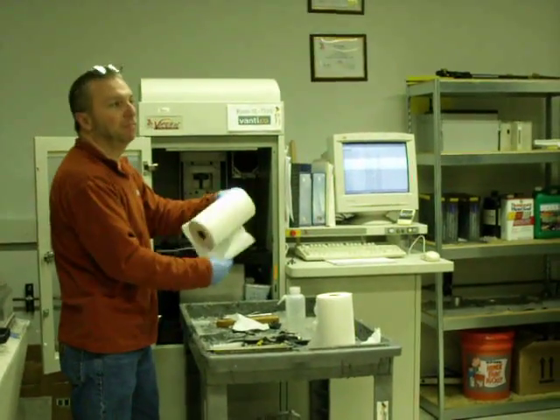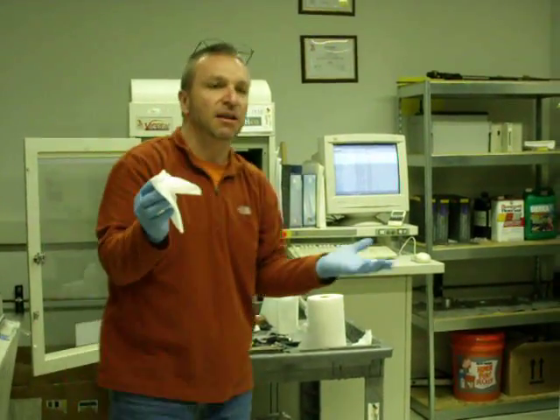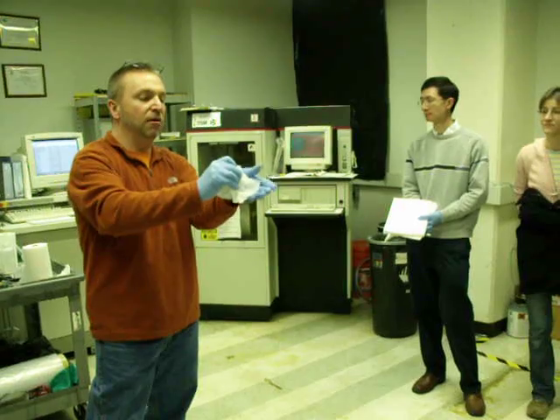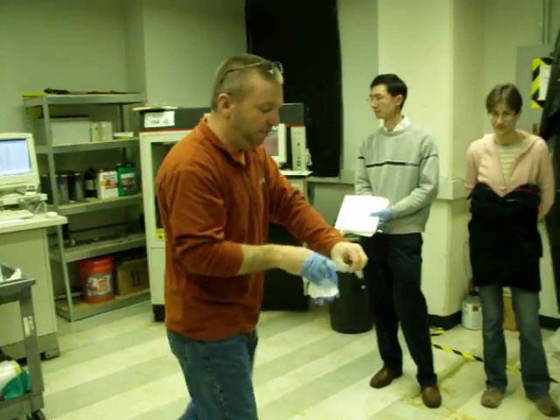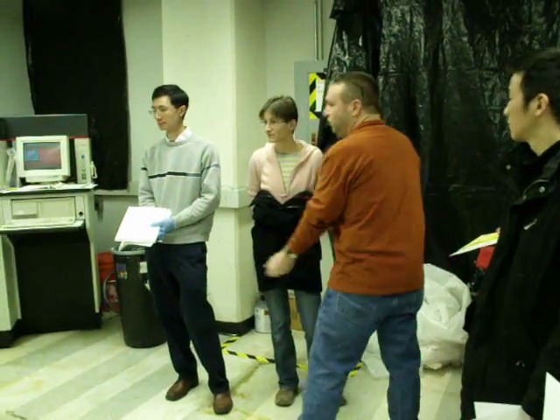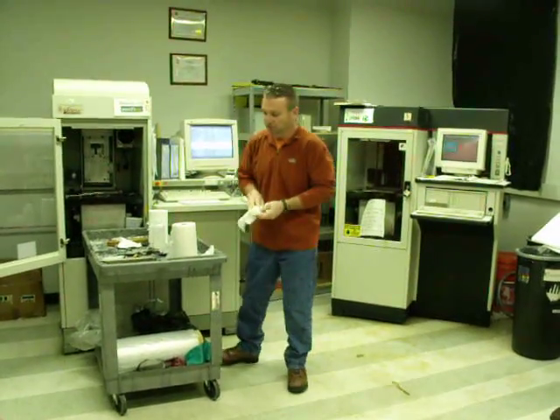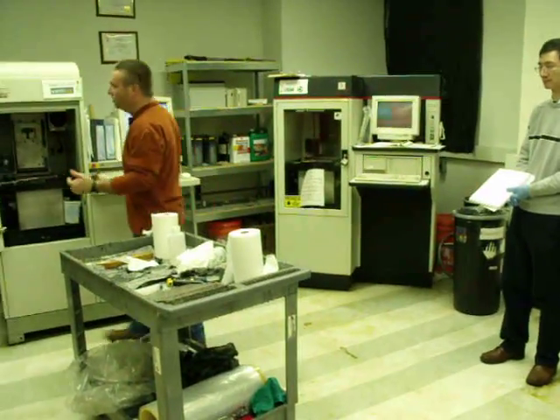If you do spill a drop, then obviously it's pretty easy just to take a paper towel and clean it up. Dealing with resin, I don't know how you guys have been doing it in the past, get a paper towel, grab your glove, and once you get one hand free, you can grab the other glove and take it off. And of course, this cart is so nasty, you probably don't really want to touch it without gloves or some kind of protection. And again, no gloves on the outside of the machine.